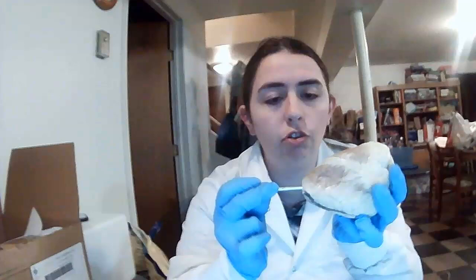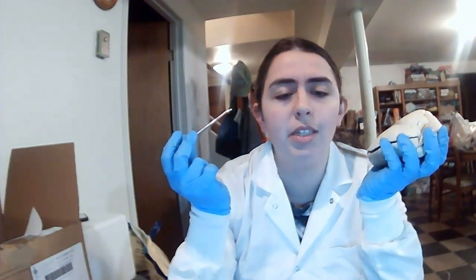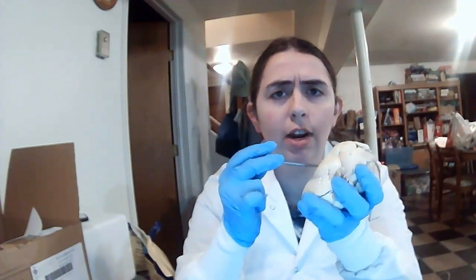In the middle of the two ventricles, roughly right over here, is the ventricular septum. This is the muscle barrier that separates the two ventricles, so that they don't cross. And there are the chordae tendineae, which are located in the ventricles, the web-like structures with muscles that prevent backwash of blood from going back into the different chamber.